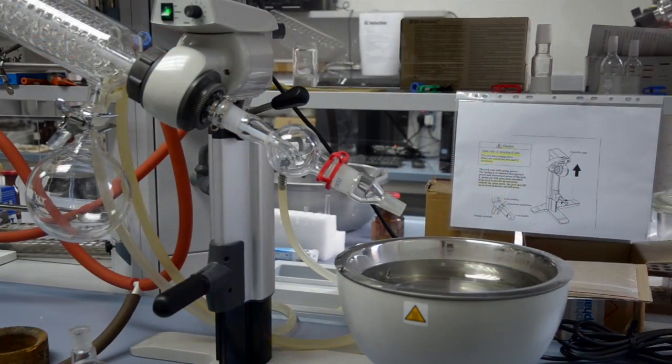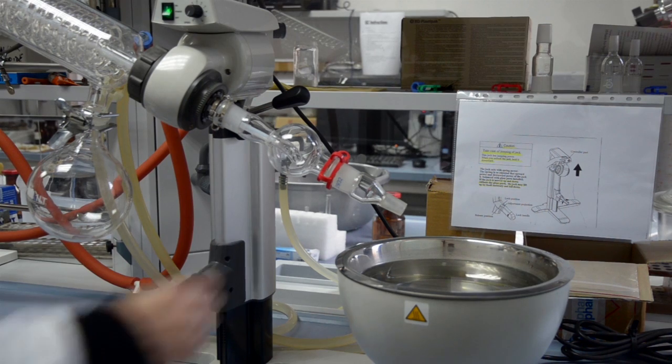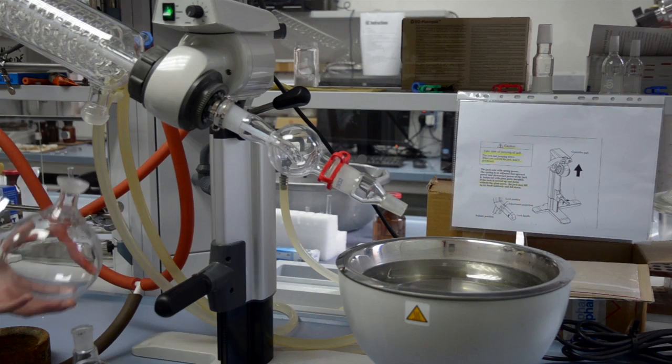Ensure the Splash Guard and Adapters are clean before being used. Use a Clamp to secure these into place. Dispose of any waste present in the waste jar appropriately.